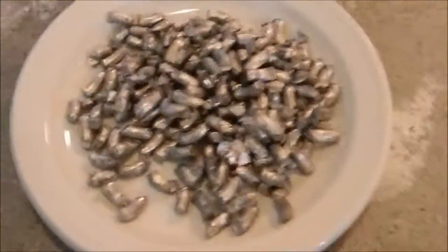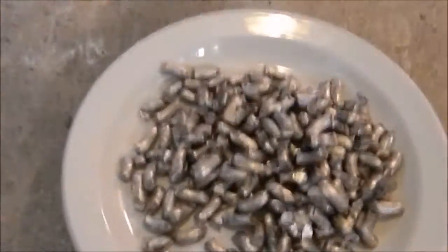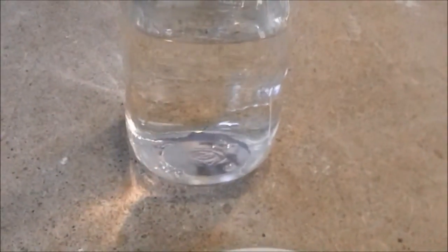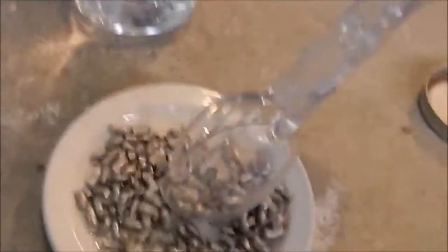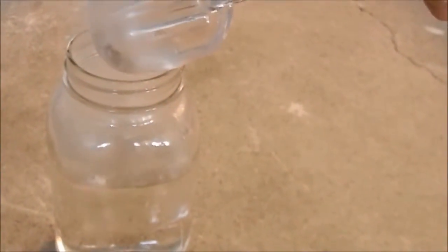Okay guys, what you're looking at there is 25 grams of pure lithium in 750 milliliters of distilled water. And here are some salad tongs. I was gonna try and collect the hydrogen, but just chose not to. Then I was thinking of burning off the hydrogen and again I just chose not to.